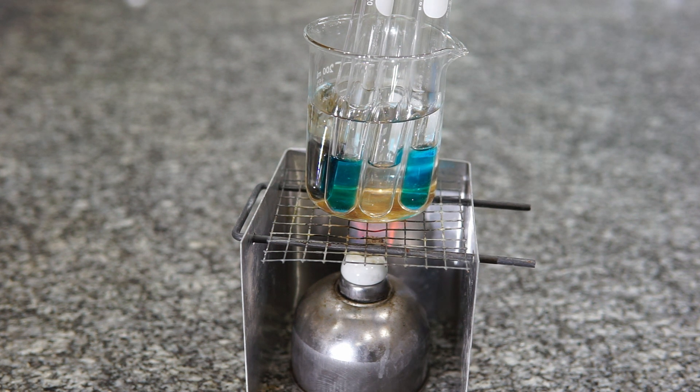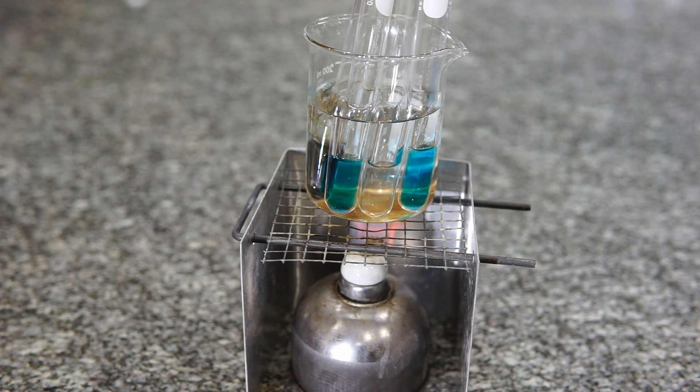And this is a really simple test because it's very visual - it's quite an obvious change. And it's something that's quite easy to perform. As you can see, it doesn't take that long, whereas some of the other tests required for organic compounds can take quite a while.